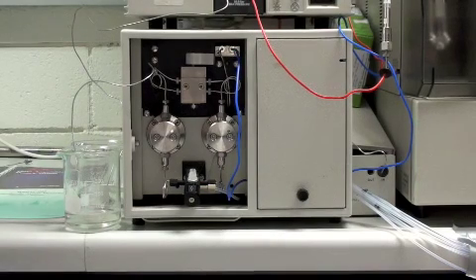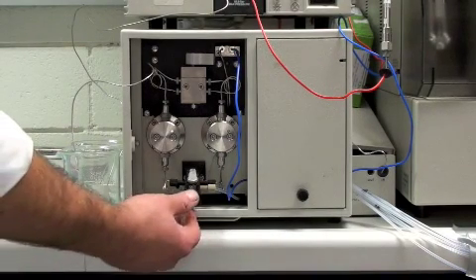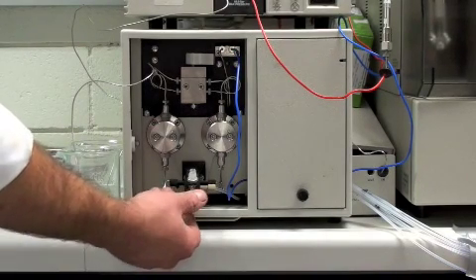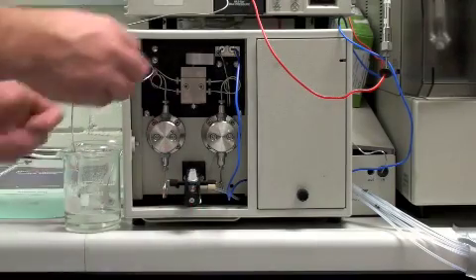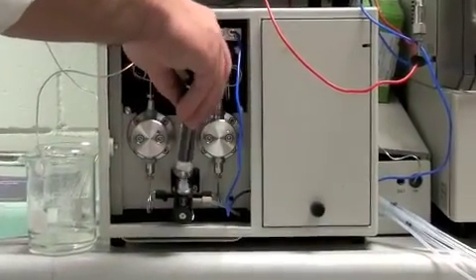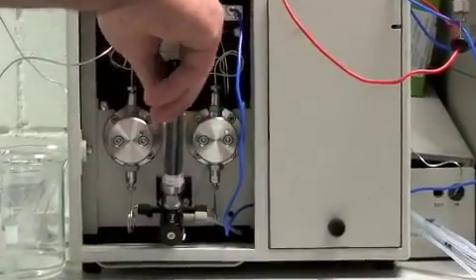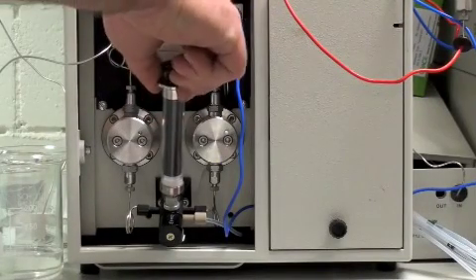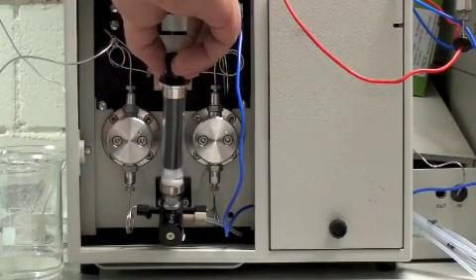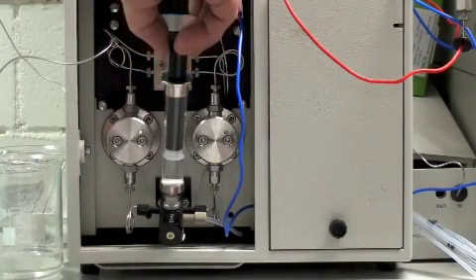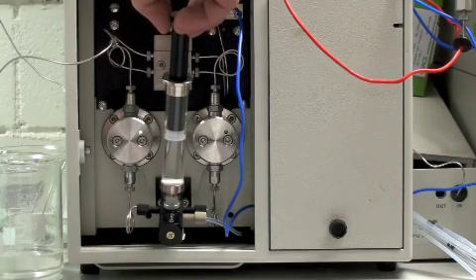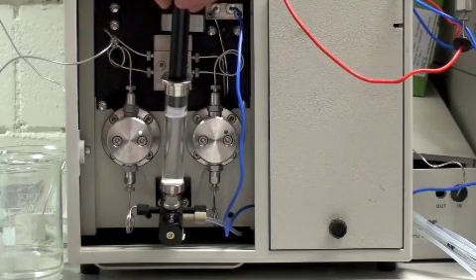The next stage in priming the pump starts with turning this switch to the draw position. You then screw your syringe in, like so. And when it's tight, draw the mobile phase up to near the full extent of the syringe, as you can see the bubbles appearing.